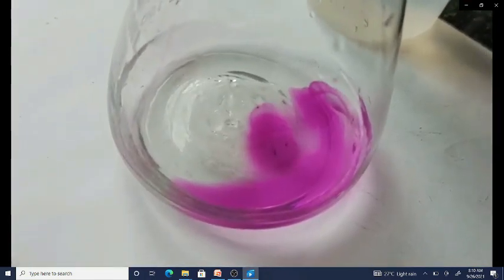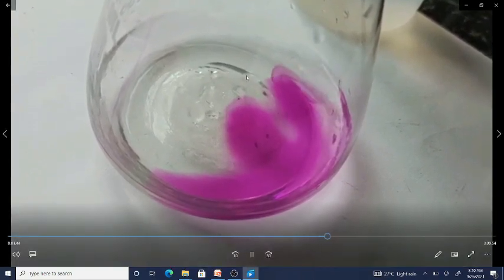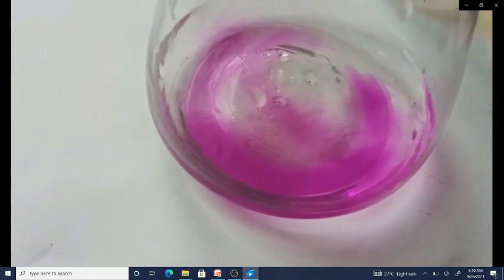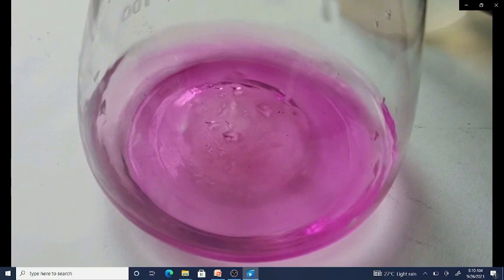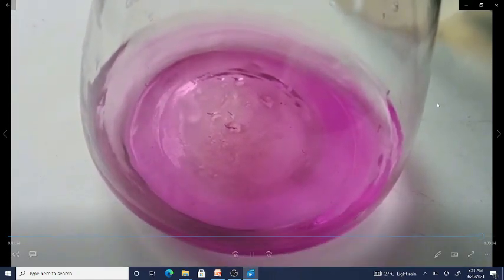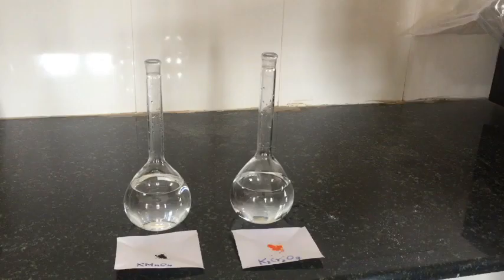You can see here — after some time we are having this. The solute particles start moving throughout the solution. Though it is not yet equalized, you can see the movement of particles. They try to equalize the concentration, and after some time we will get equal concentration.